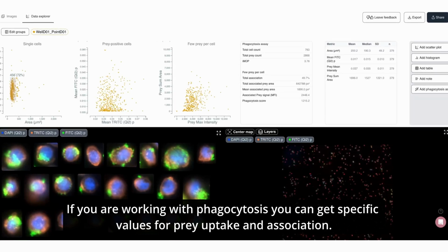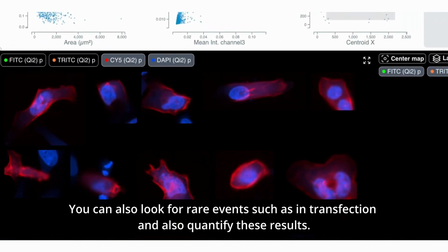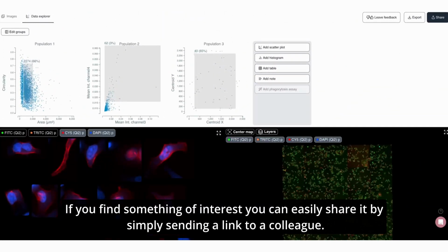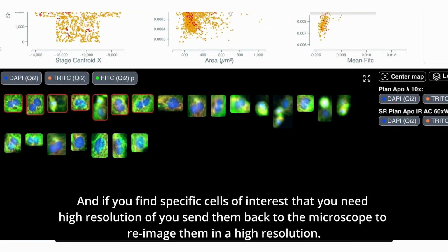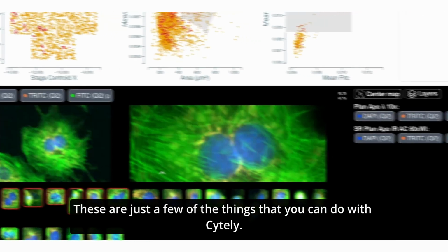If you're working with phagocytosis, you can get specific values for prey uptake and association. And you can also look for rare events such as in transfection and also quantify these results. If you find something of interest, you can easily share it by simply sending a link to a colleague. And if you find specific cells of interest that you need high resolution of, you send them back to the microscope to re-image them in a higher resolution.